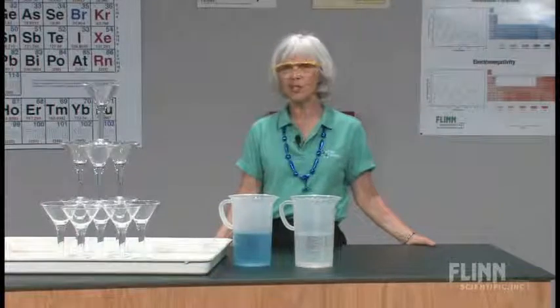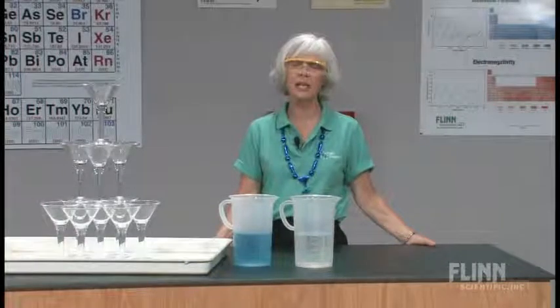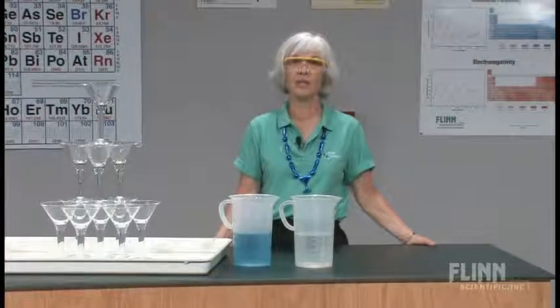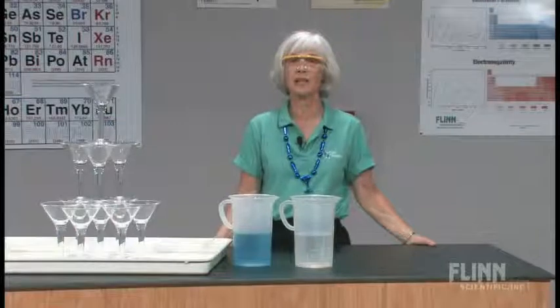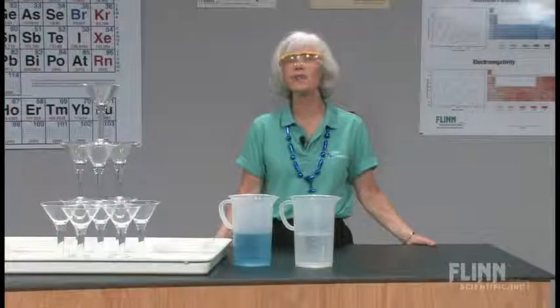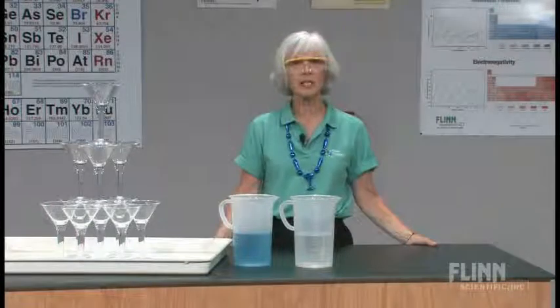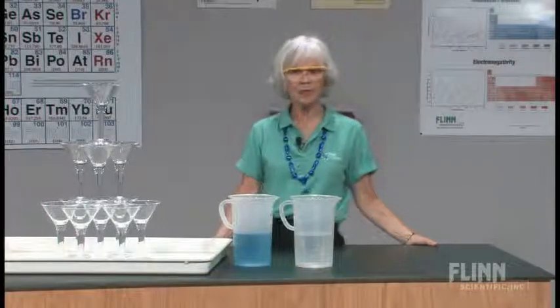Just as a teaching tip: after any break, even a three-day break from class, it's always good to do a demonstration when they come back in. So what I do is perform this demonstration.